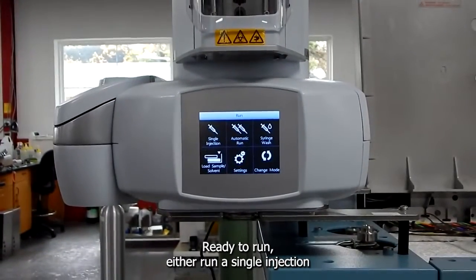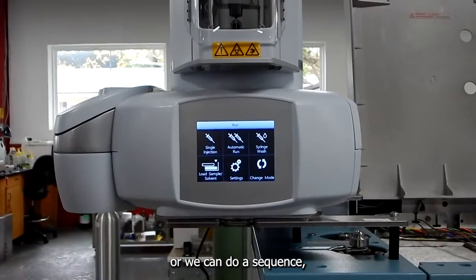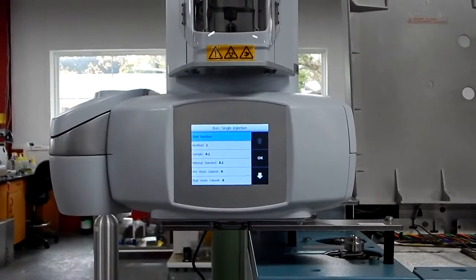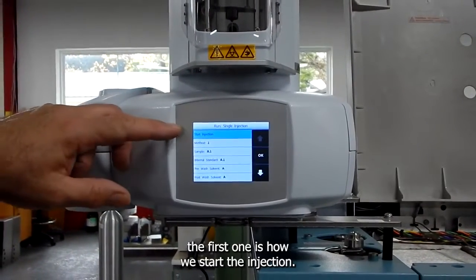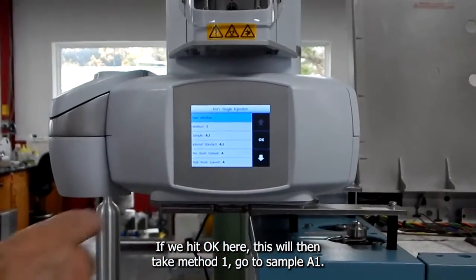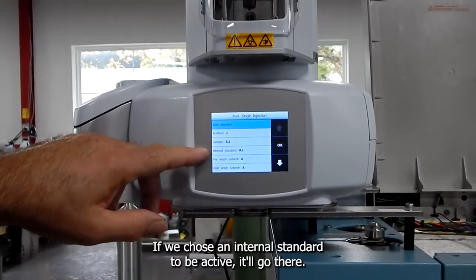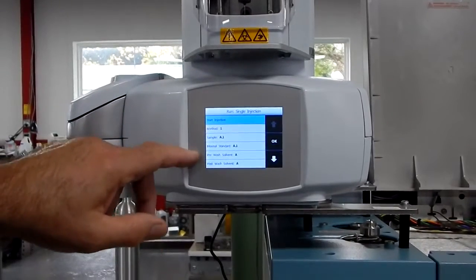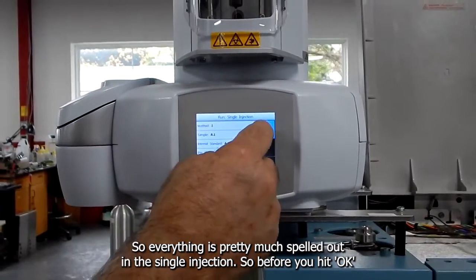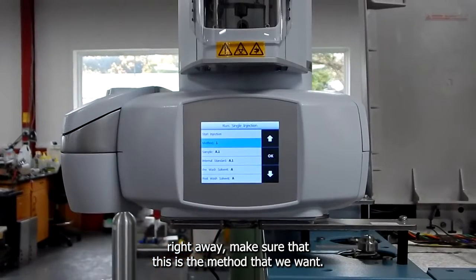When we're ready to run, you can either run a single injection, or we can do a sequence and do an automatic run. A single injection. The first one is how we start the injections, the whole process. If we hit OK here, this will then take method 1, go to sample A1. If we chose an internal standard to be active, it'll go there. We'll do pre-washes here. So everything is pretty much spelled out in the single injection. So before you hit OK right away, make sure that this is the method that we want.